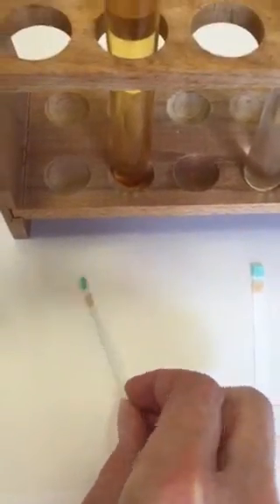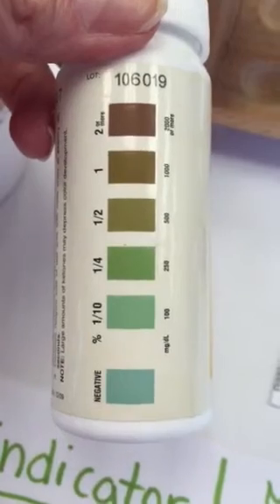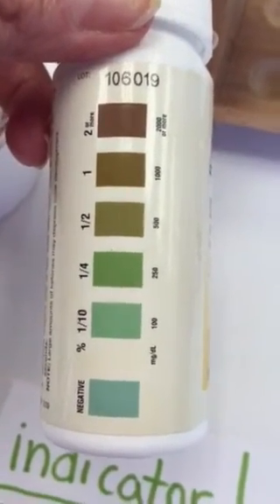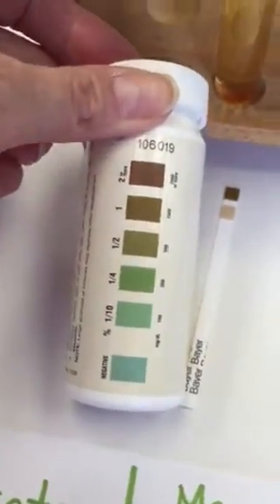And let's now test for glucose, simple sugar, in apple juice. As you can see already, it's changing color. And if we take a look on the back of our test strip bottle, it lets us know the amount of glucose that's present. So we'll just take our test strip and compare it to the bottle. In this case, there's a lot of simple sugars there — the test strip turned dark brown.